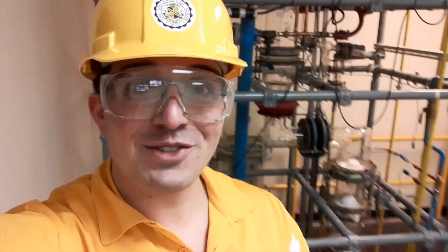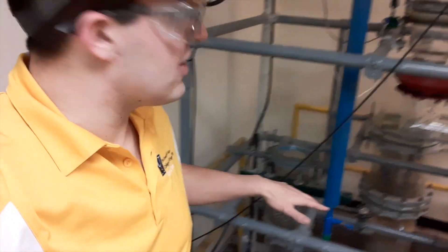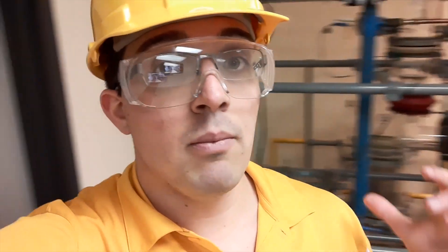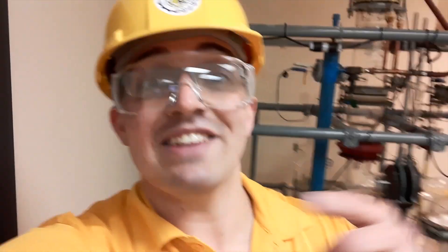Alright guys, this is where we get to have a little bit of fun. Right now I am currently in the distillation lab here in ASEC 81. Chemical engineers, you are going to spend a ton of time here, not only working with this machine but getting to know the entire process of distillation. This is also where corrosion engineers and chemical engineers are both going to do your PMT mechanical work. PMT is project management and teamwork, and when I get downstairs to that lab space I'll explain a little more.